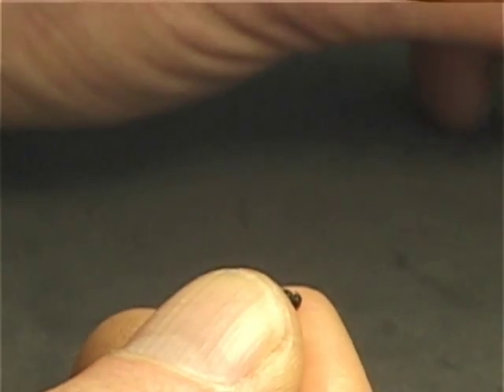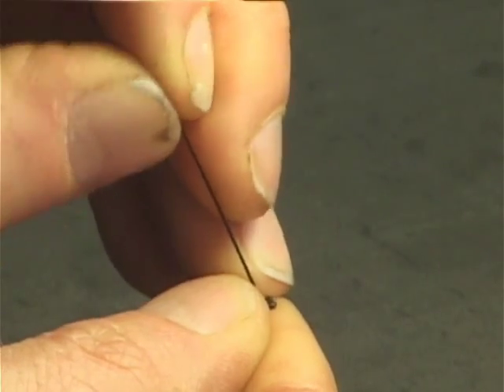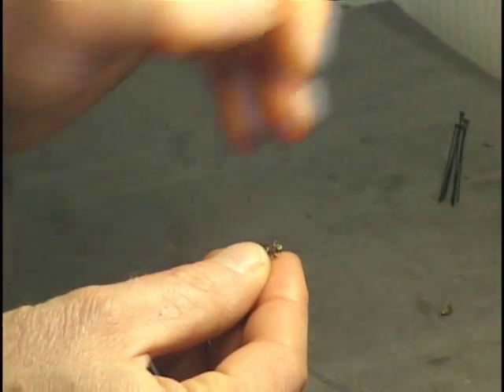It's a balance, but it's something you can very quickly get used to setting without having to use pinning blocks. The bottom line is that you want the specimen to be horizontal to the pin and not roll to either side. With a bit of practice, you can do that all quite quickly.